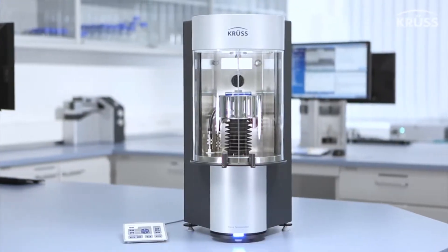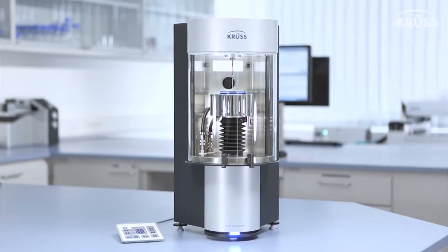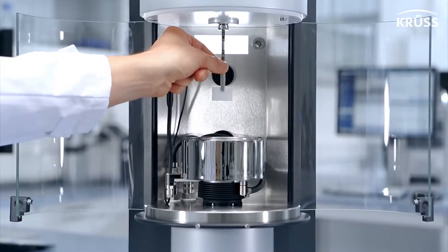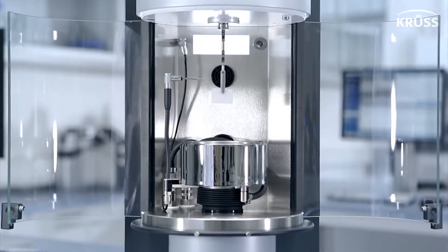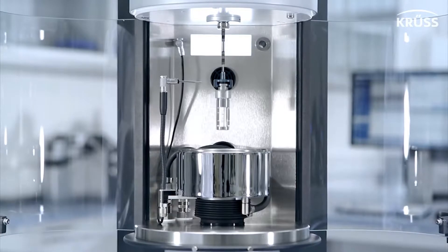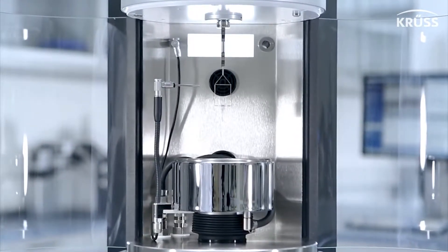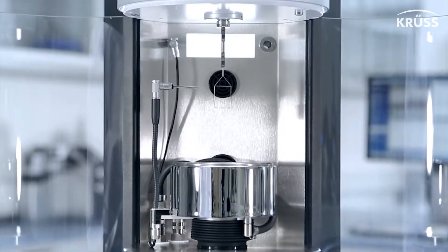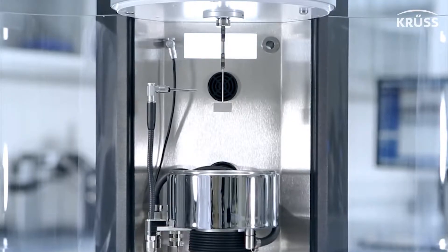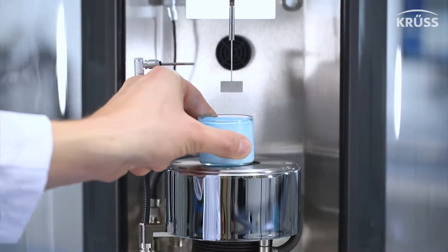With the Krüss force tensiometer K100, such an instrument is here. This tensiometer gives you actionable data using many different measurement methods, such as the dynamic contact angle even of your own samples and powders, the wettability of single fibers, the surface and interfacial tension with the Du Noüy ring and Wilhelmy plate methods, and many more.